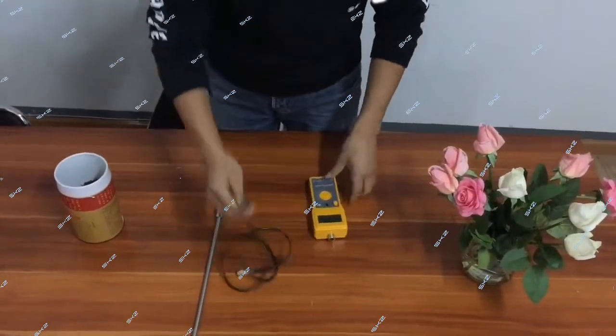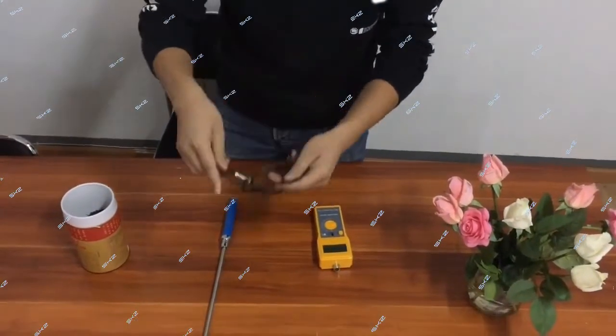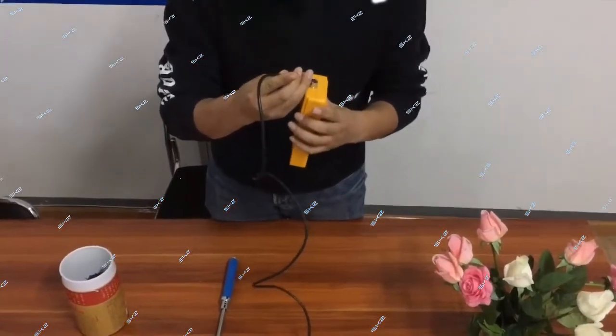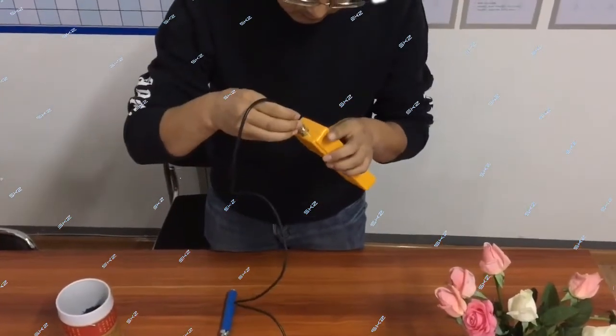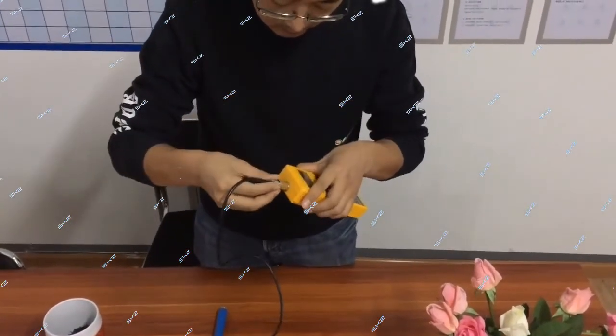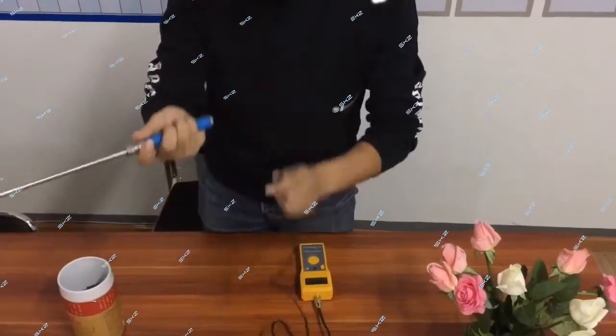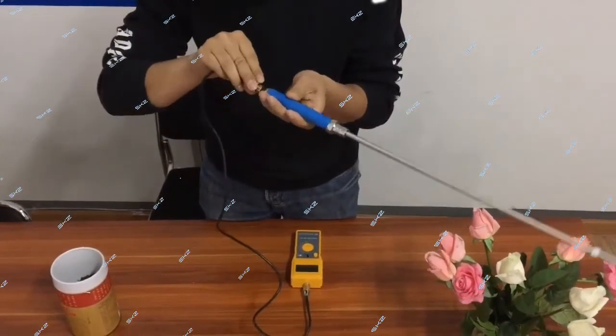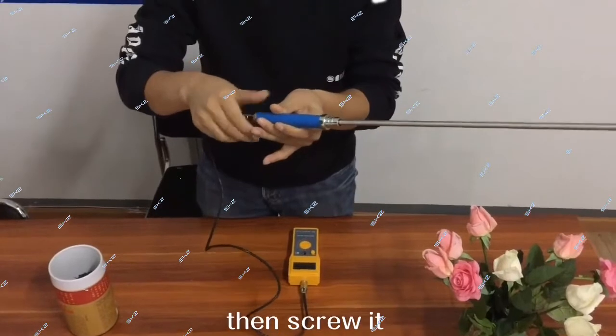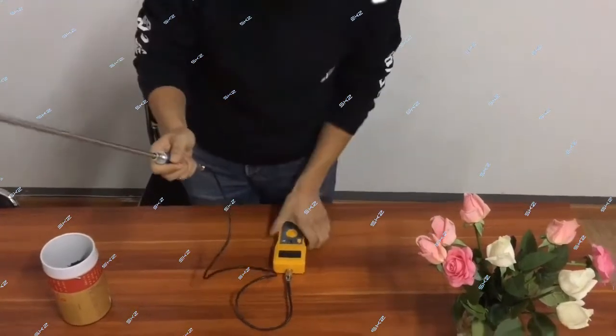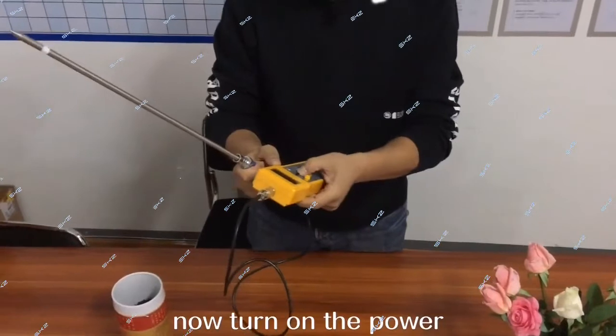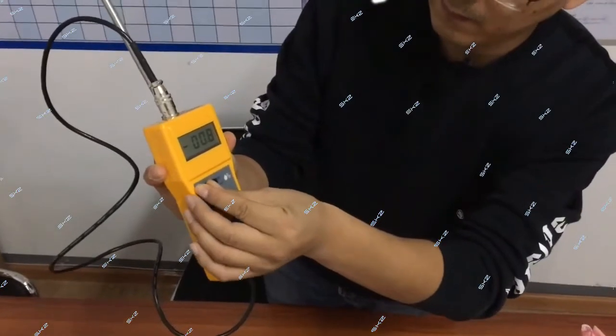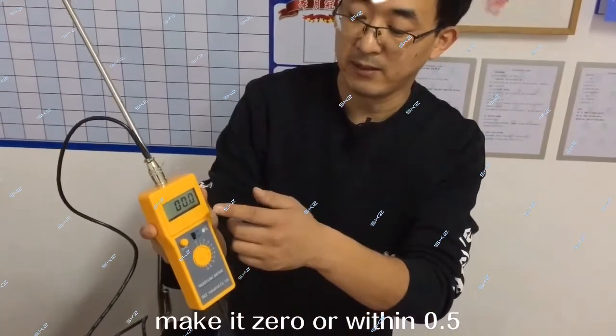Okay. Now I will contact this one, this cable. Now I will turn on the power. I have to make it 0. Make it 0 or within 0.5.